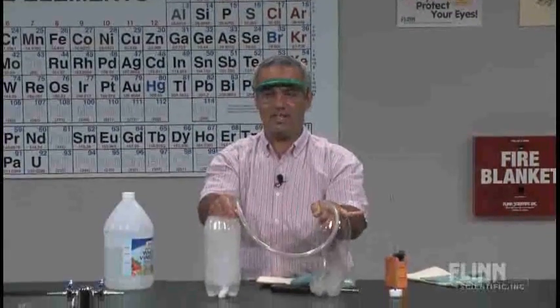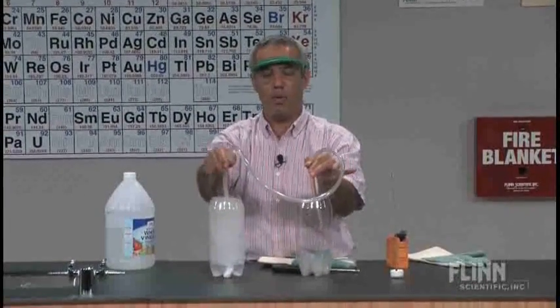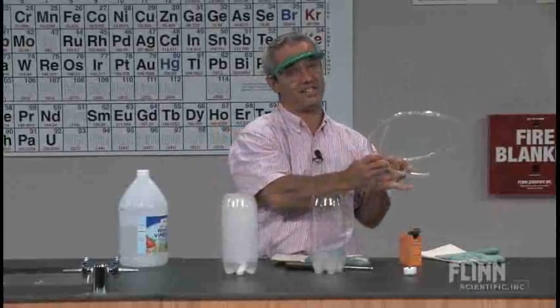So a couple of neat demonstrations there involving pouring and siphoning a dense gas.